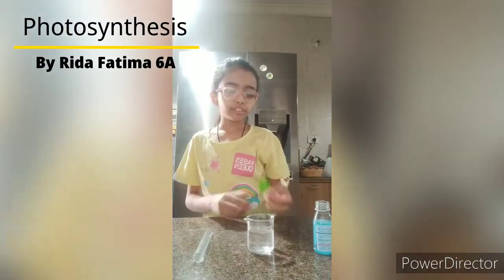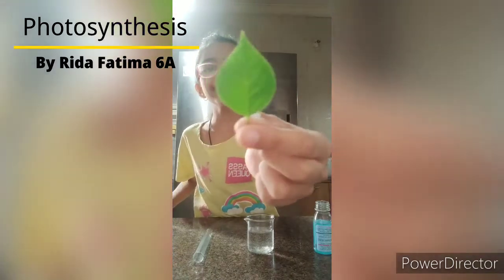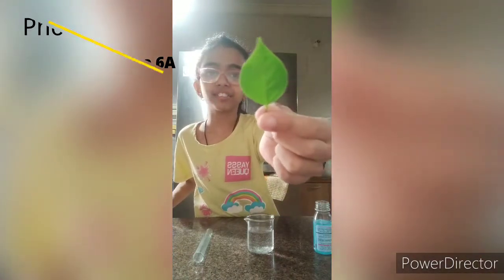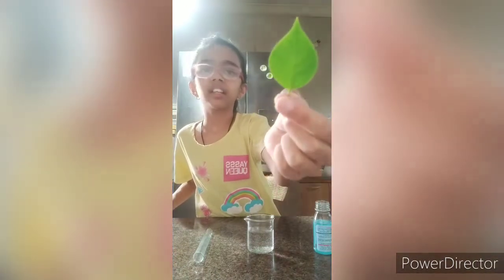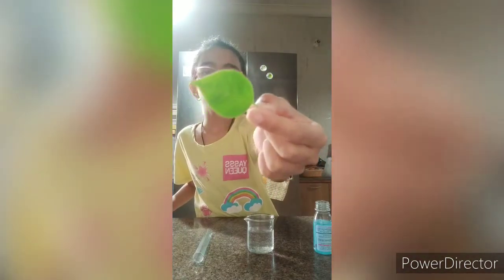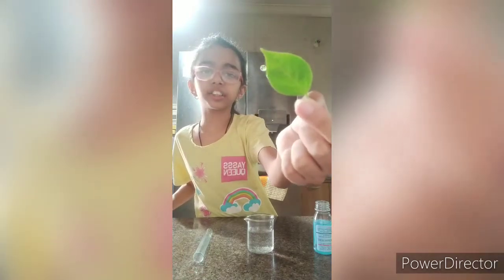Good morning everyone. Today, I will prove that the process of photosynthesis takes place in a green leaf of the plant. The green leaf is the kitchen of the plant. It produces food which is known as starch.